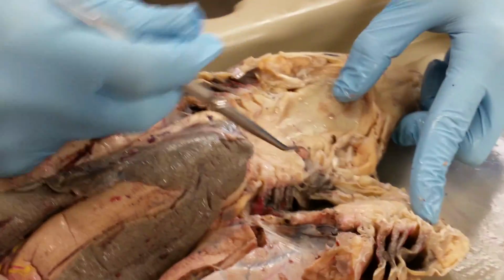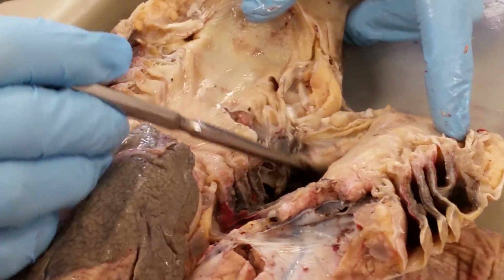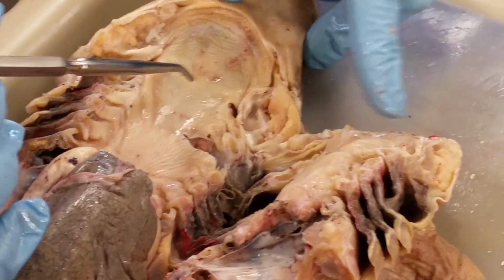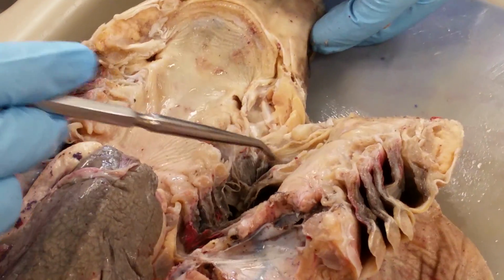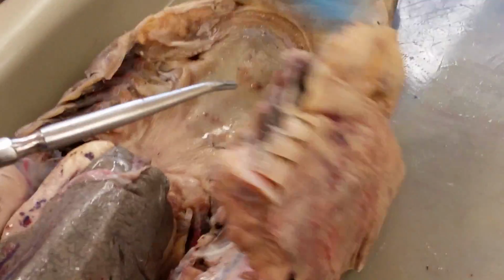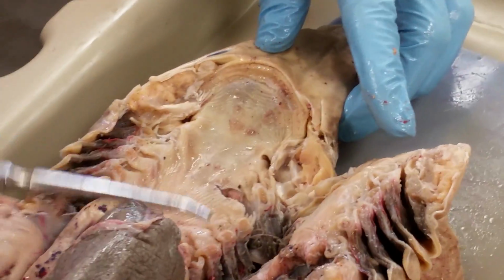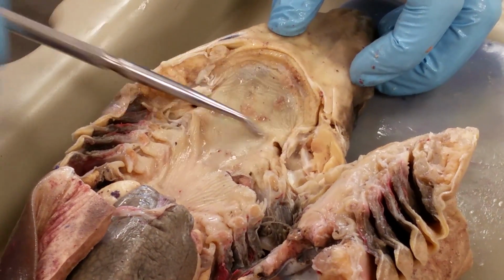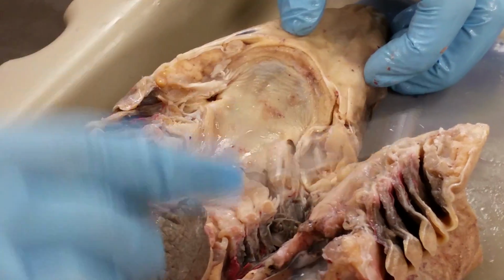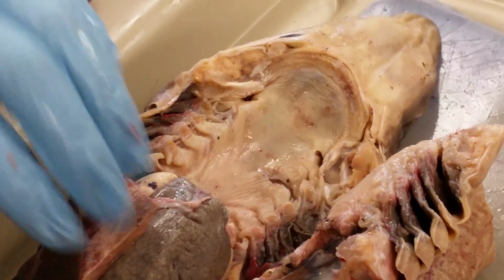Yeah, just hold that down. Alrighty. So here you can kind of see how these are like gill chambers, probably more obvious than the other way I was putting it out. So these are called internal gill slits, right? Whereas these are the external gill slits. So that was one more thing on the gills. Okay, so for the mouth, this is our oral cavity here. This is our pharynx. This is the tongue. It's not really movable like ours is.